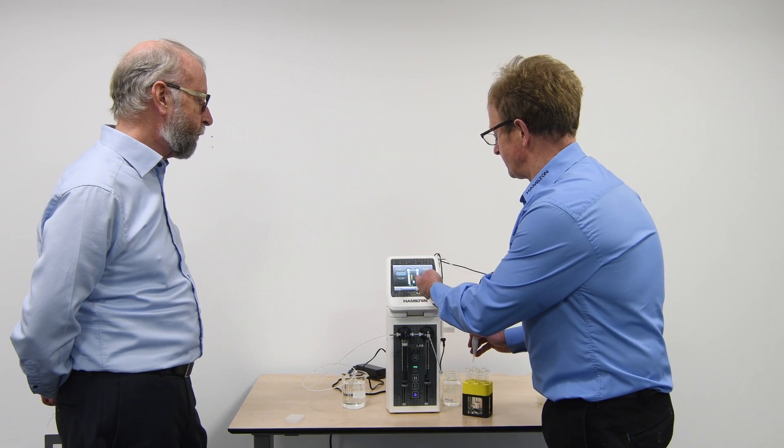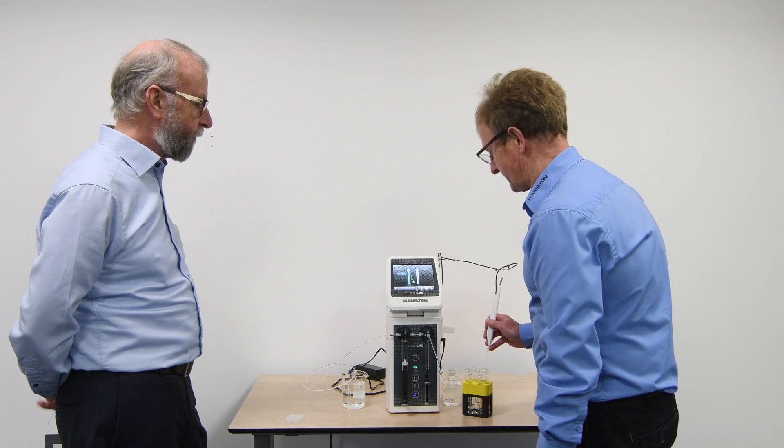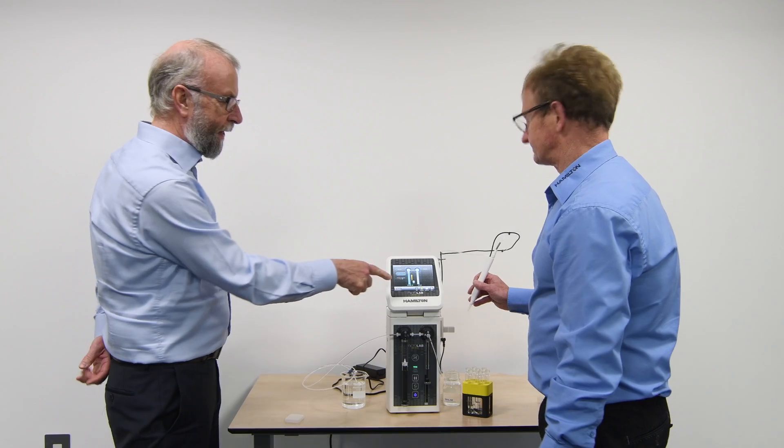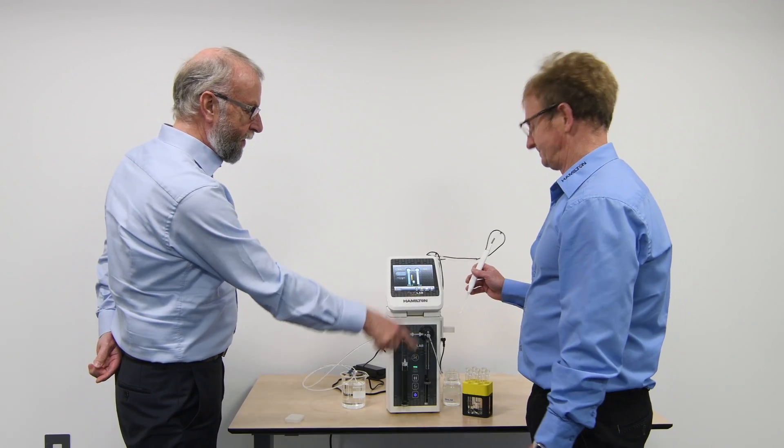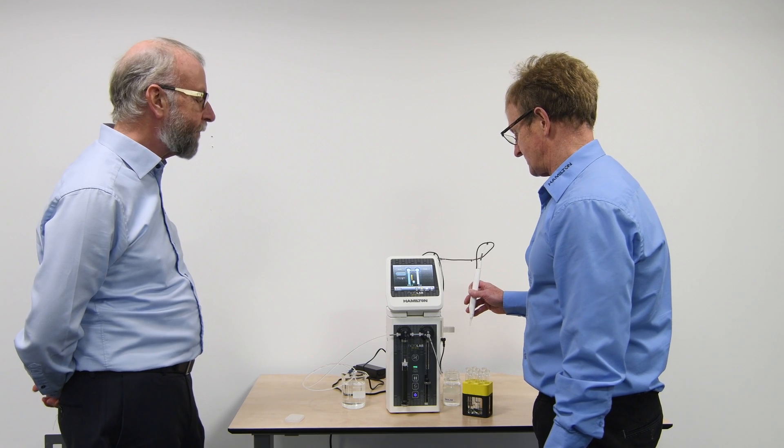And the last step here, it's filling again, so it's a few seconds, and it's ready to go again for the next row. So that's the time, the six to eight seconds I would save, if I'm using it in the two syringe mode. Yes, that's right.